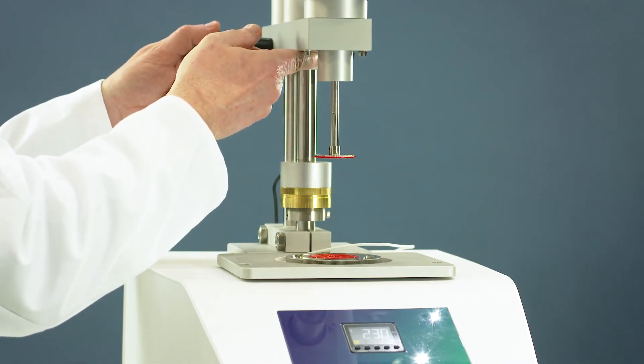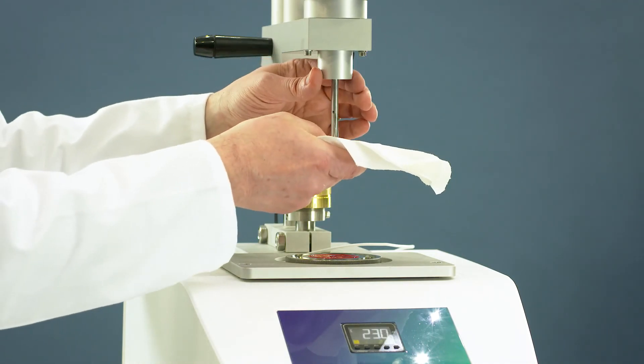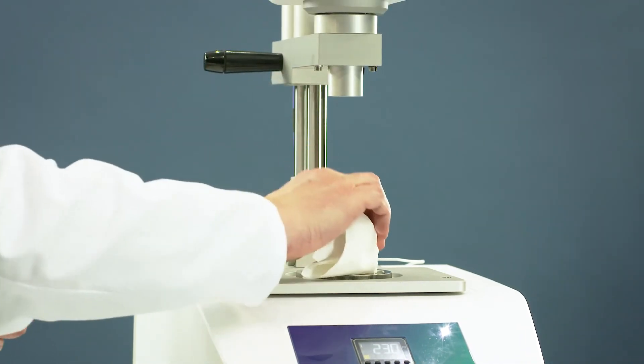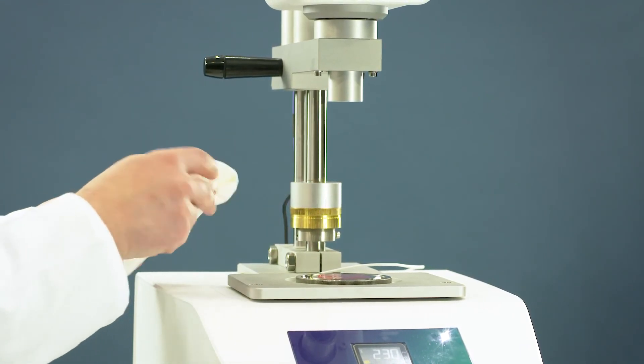Remove the cone plate to clean it. As you can see, measurement with RM100 CP2000+ is very easy.